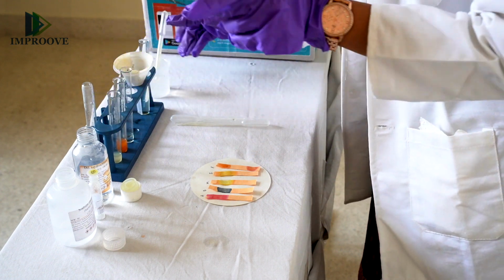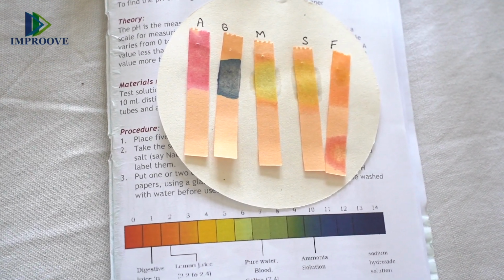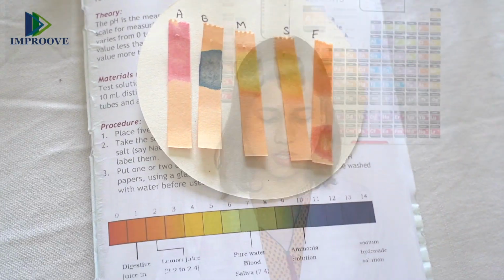The pH strip helps us to compare the acidity and alkalinity of different solutions. So we have the results here. As we dropped the different solutions over the pH strip, you would notice that when we dropped hydrochloric acid, it immediately turned red, denoting that the dilute hydrochloric acid is highly acidic in nature. Sodium hydroxide is basic in nature, hence the pH strip turned blue.